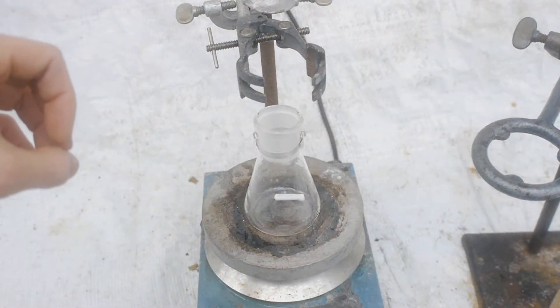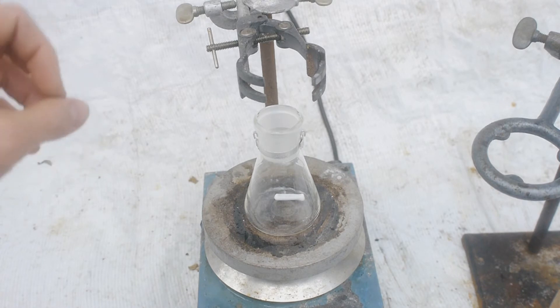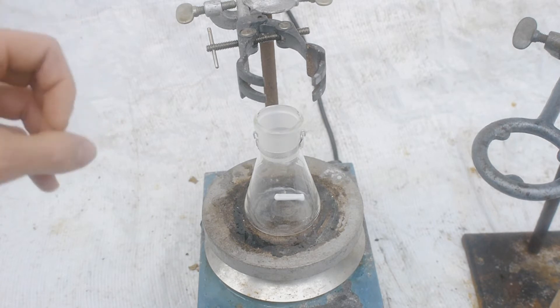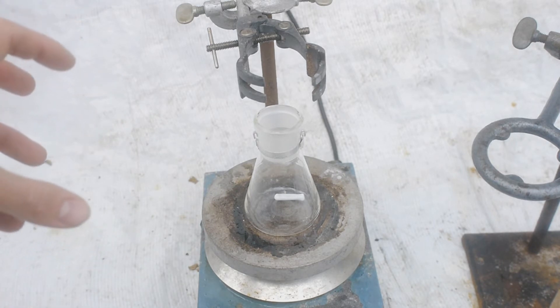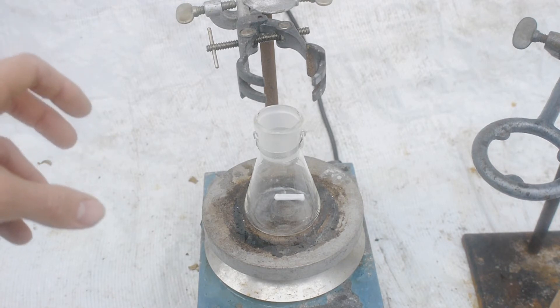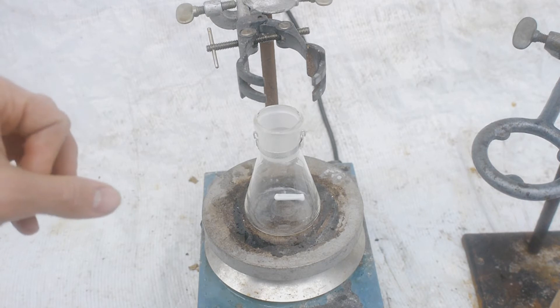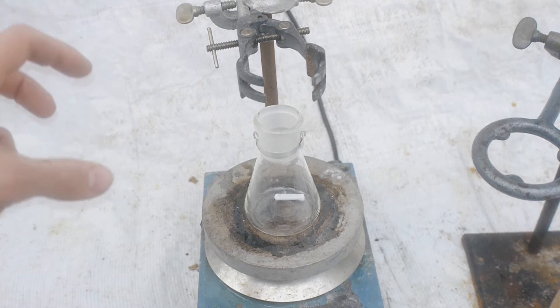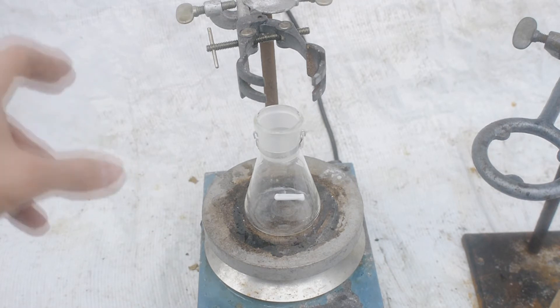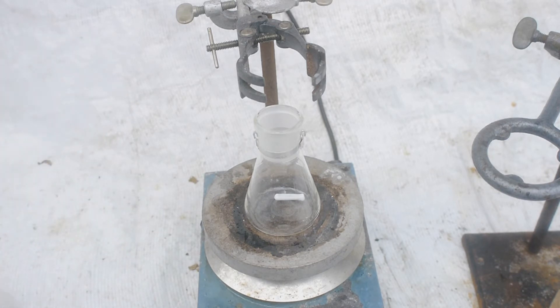That was quite a fireball. I now want to make some ethylene, which is very similar in formula but quite different in its properties — these two gases are quite often confused. The acetylene we just made has the formula C₂H₂. What I'm now going to try to make is ethylene with the formula C₂H₄. Acetylene has a triple carbon-carbon bond and ethylene has a carbon-carbon double bond. There are no rocks we can just toss into water to make ethylene.